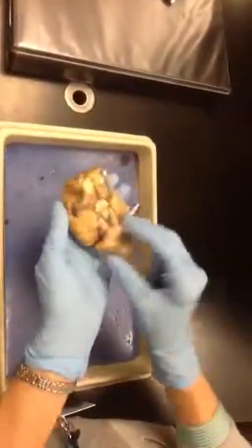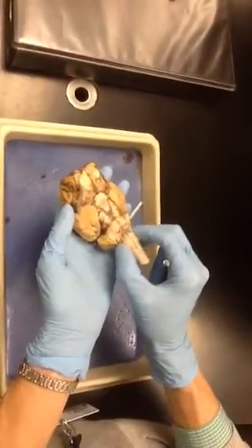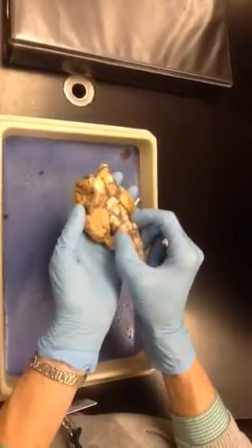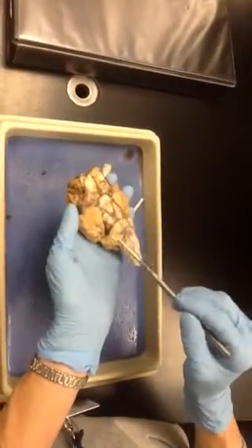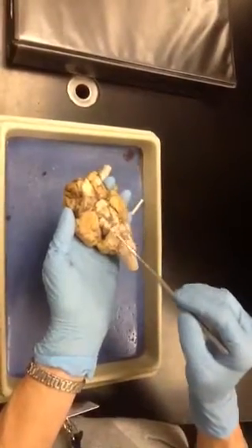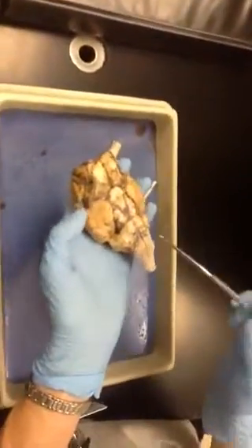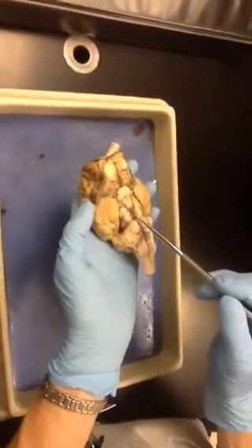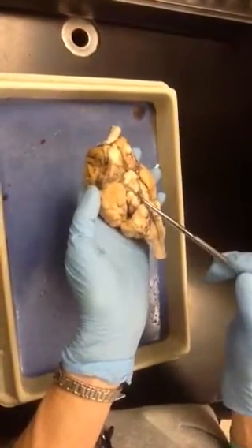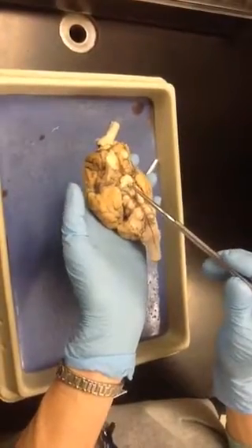If we turn this over, again, here's the spinal cord. This first enlargement right on top of the spinal cord is the medulla oblongata. These bumps right here is the pons. These two columns coming up on top of the pons are called the peduncles. Okay. This little bump right in here is called the mammillary body, little booby right there. Okay, that is the central canal.